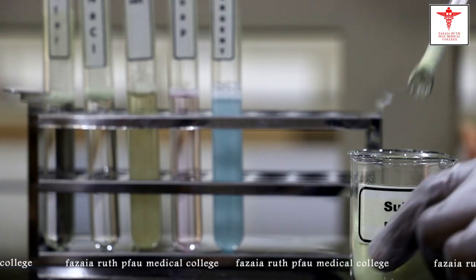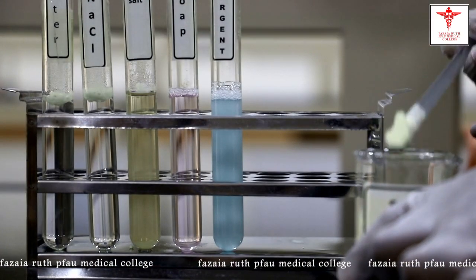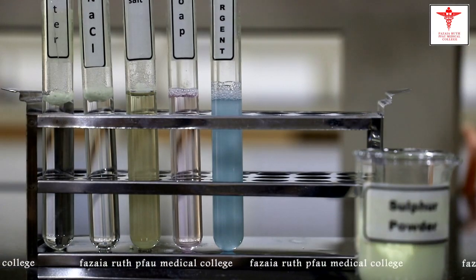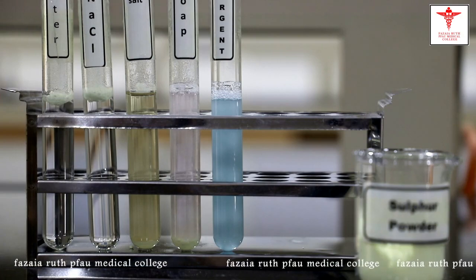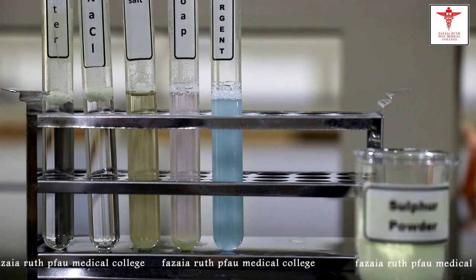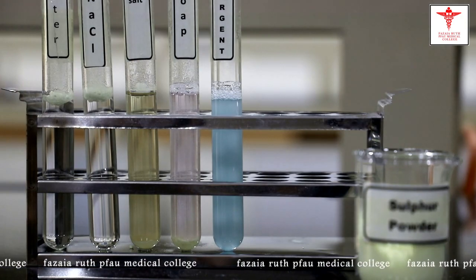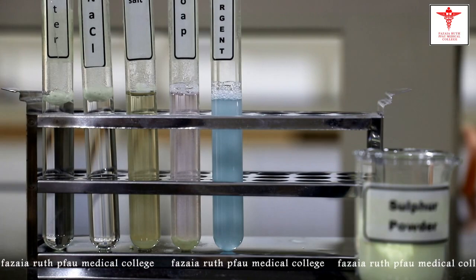Okay, we'll now add powder to the fourth test tube that contains soap solution, and again the powder has settled down at the bottom, which shows that the surface tension of this solution is also lower than that of sodium chloride and water.